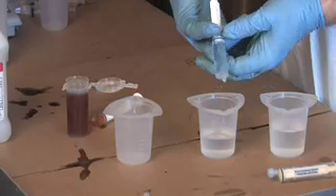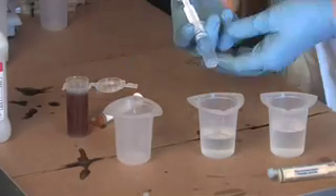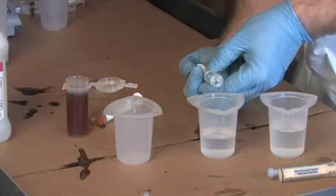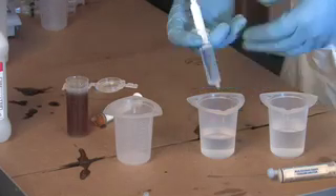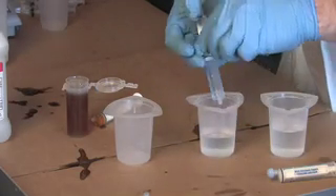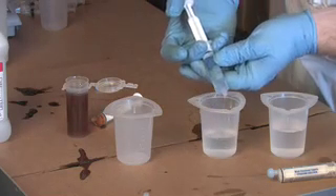This is somewhat of a messy process so you want to wear gloves. There's just no clean way to do biodiesel — I've yet to meet anyone that has. Buy some kitty litter or oil dry if you want to keep things clean.